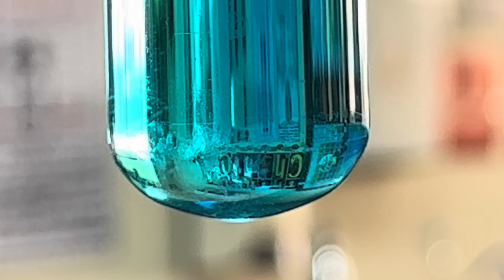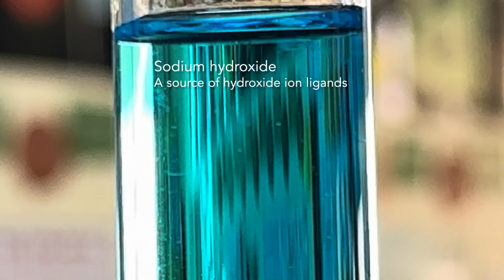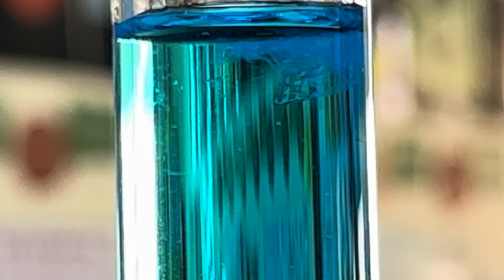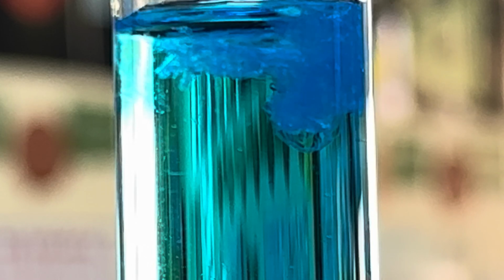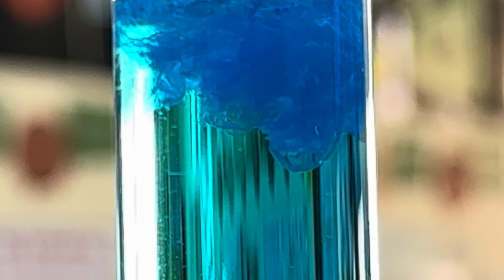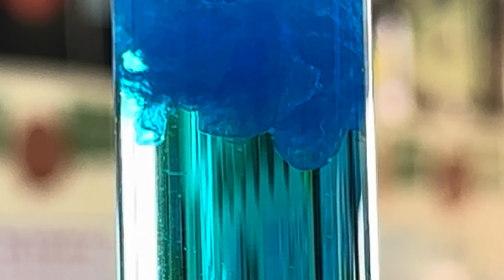So I've got some sodium hydroxide that I'm going to be adding into the solution. You can actually see immediately something new is forming. So the sodium hydroxide contains sodium ions, but the sodium ions don't really participate in any way whatsoever within the reactions that you see in front of you.